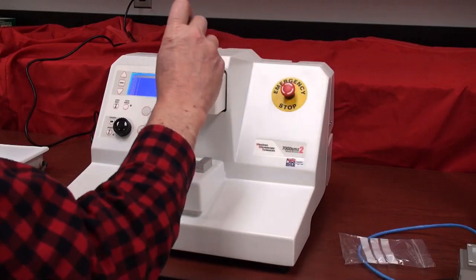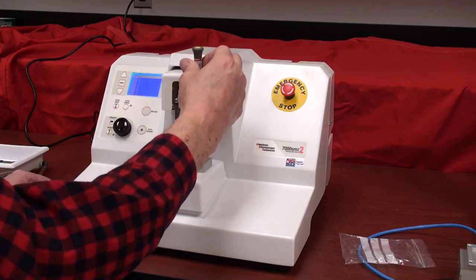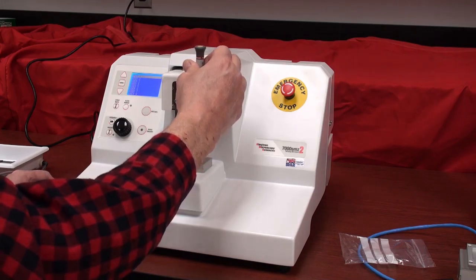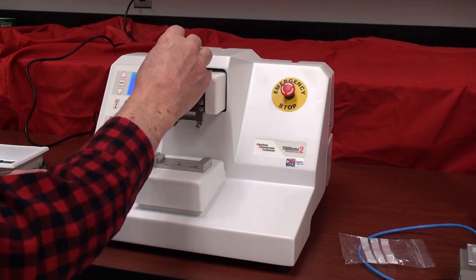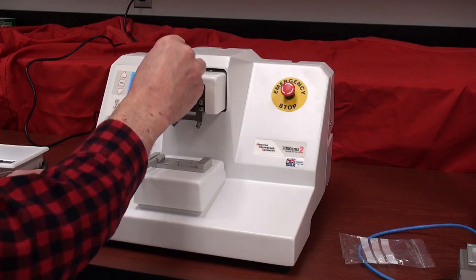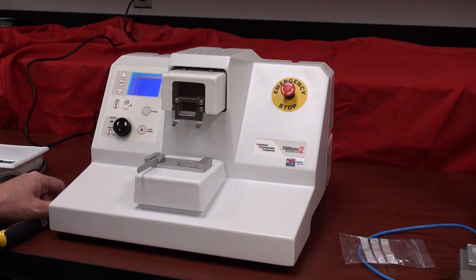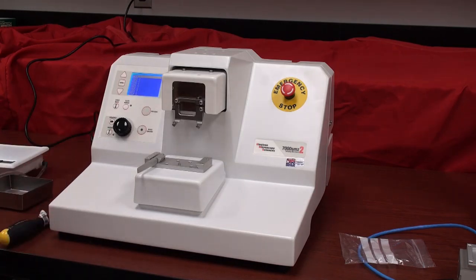When loosening, normally in the US it's righty-tighty, lefty-loosey. But on the left-hand threaded side, you turn it to the left to tighten instead of the right. This is where you can inadvertently break the screw by thinking you're loosening it when you're actually tightening it. These are very small metric screws and it takes some effort to extract a broken screw from the threads — which is why spare hardware is provided, and also because they're small and easy to drop and lose on the floor.